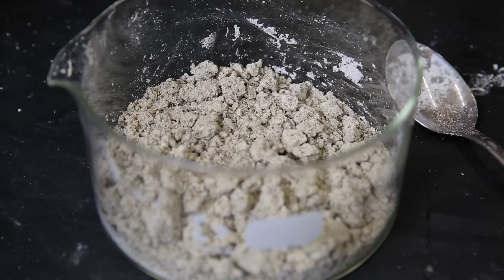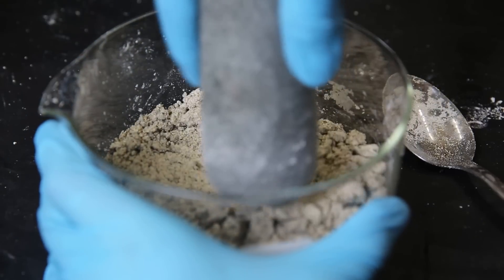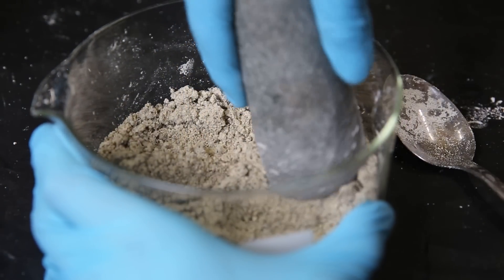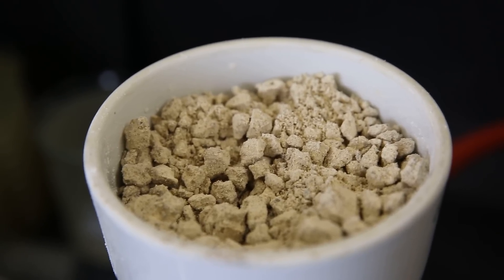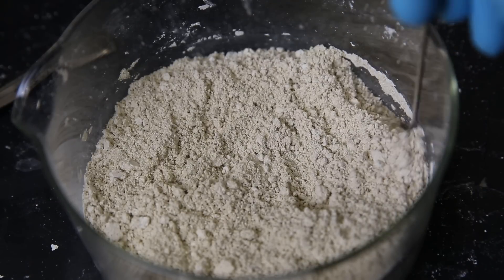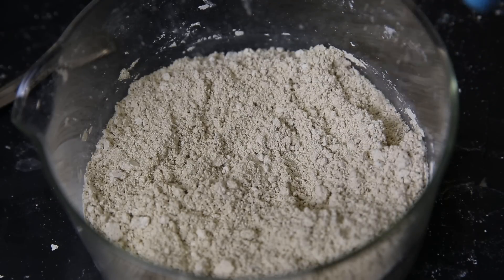Before the last wash, it looked like this. I crushed it and then washed it again. Then I let it dry on the filter for 2 hours, and it got a lot lighter. Then I crushed it into a powder again, and now that it is a lot cleaner, I can move on with the next step.